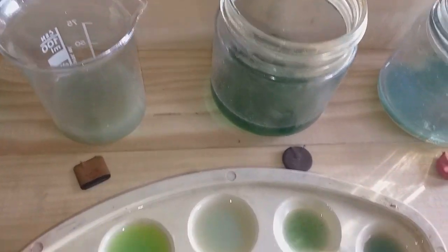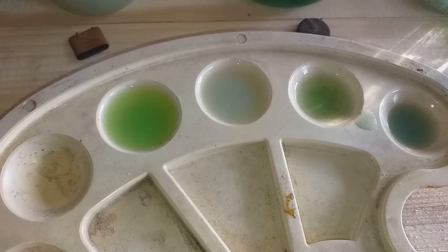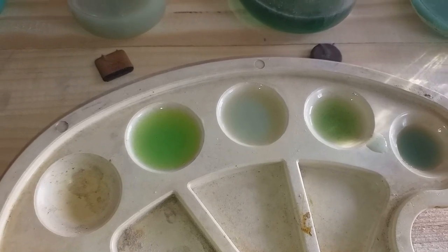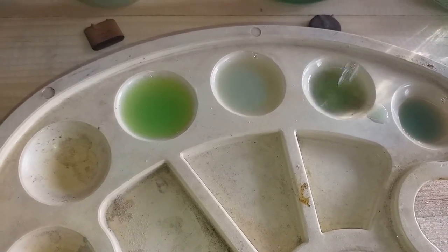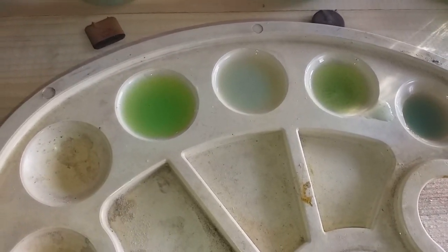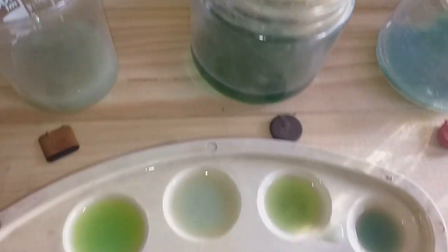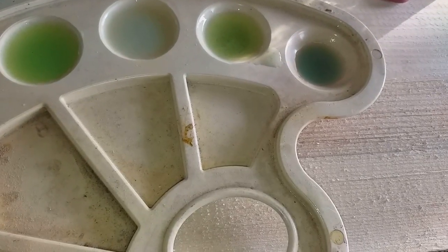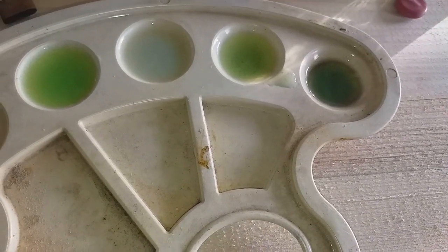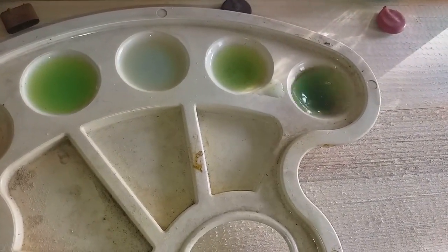Let's see the black one, number three — pretty slight reaction. Small reaction here, almost — see that? So definitely this one contains just a little palladium. And of course, for the last one — the red one. You see that? Very, very strong reaction. So the red one looks to contain the best amount of palladium of all.